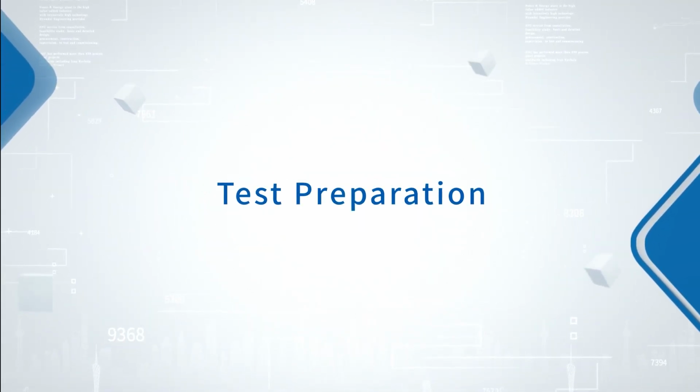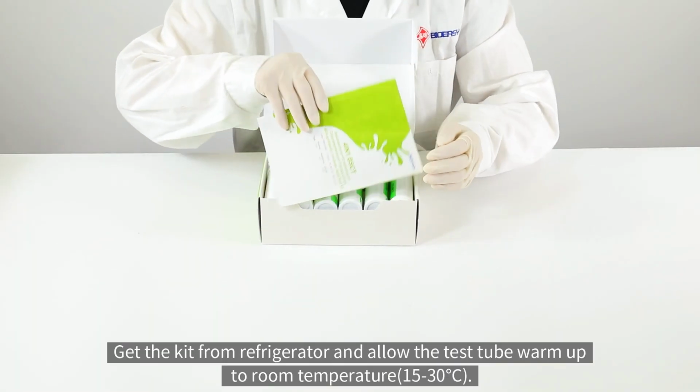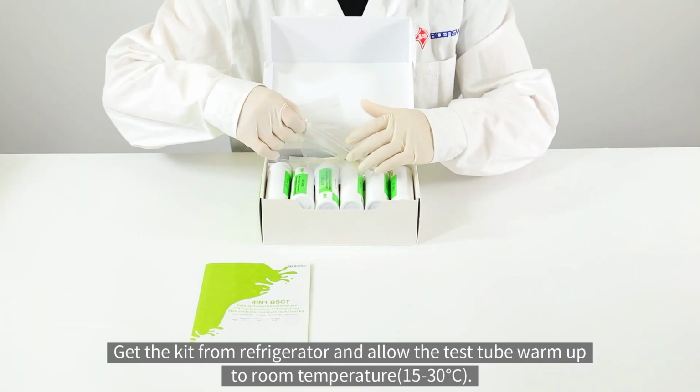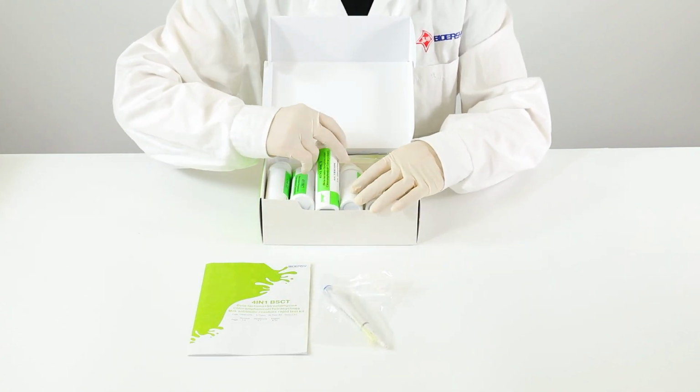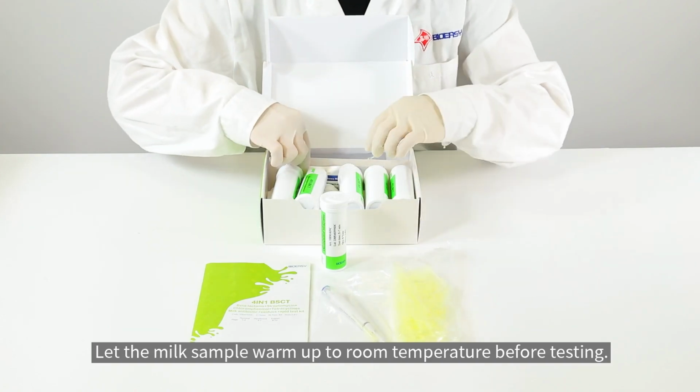Test preparation. Get the kit from the refrigerator and allow the test tube to warm up to room temperature. Let the milk sample warm up to room temperature before testing.